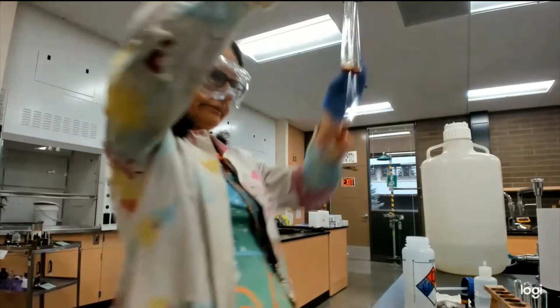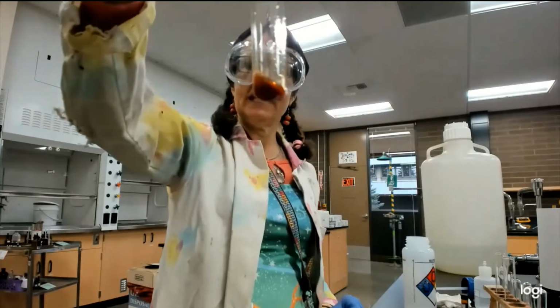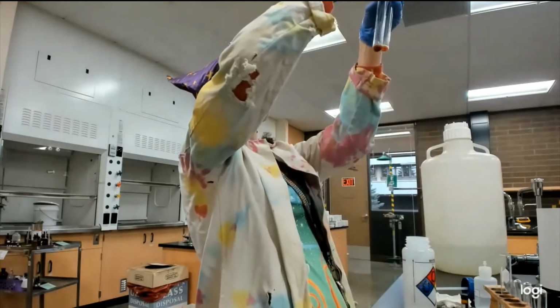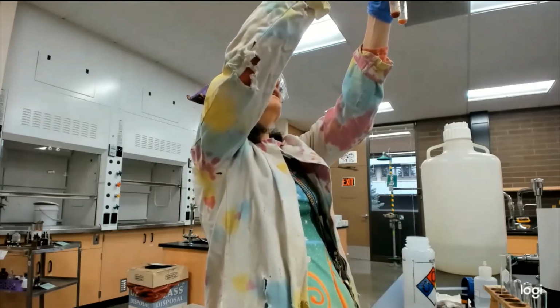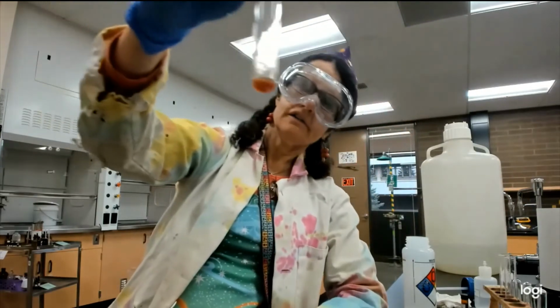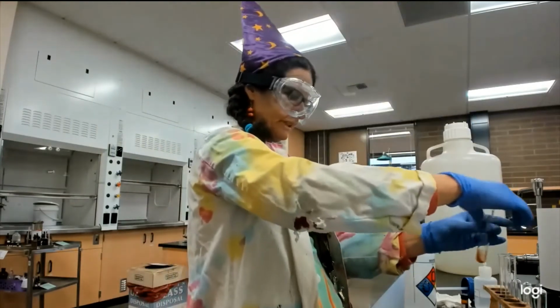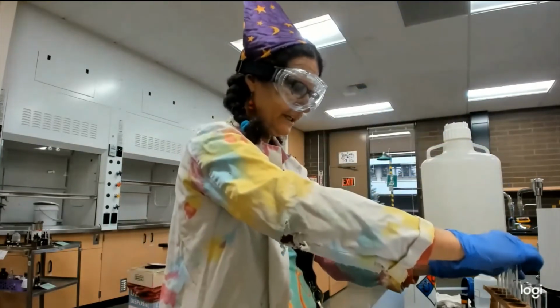You know, this one is definitely a rose red. My unknown. Well, we might have a winner there. And then the ether, it's like a deep orange, but it's not the rose red. Oh, that's because we heated them.